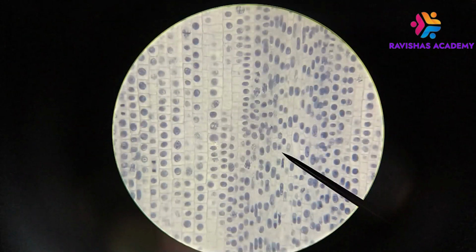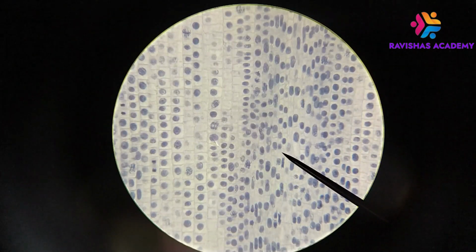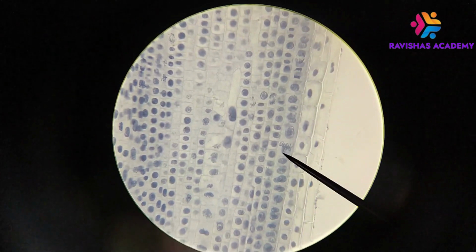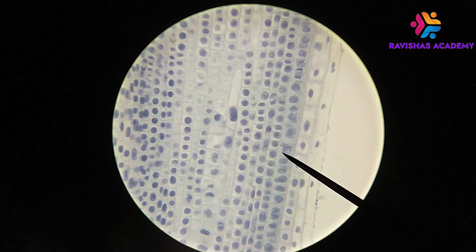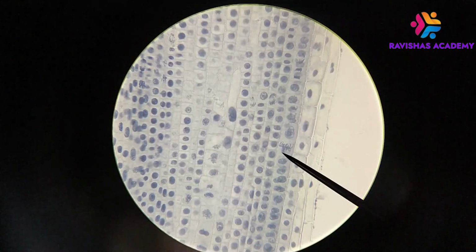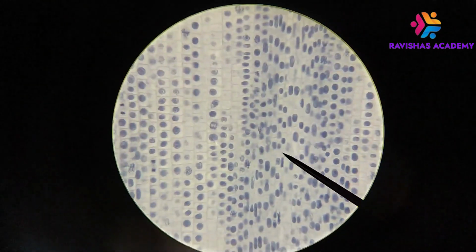Let's adjust the focus on this. Here we go. And so right now, what you can see is some of these cells look different than the others. Let me just see if I can maybe increase the contrast in here a little bit. One of the problems with cameras these days is they are so smart that they just adjust automatically for whatever you're trying to do. So it's as good as it's going to get.